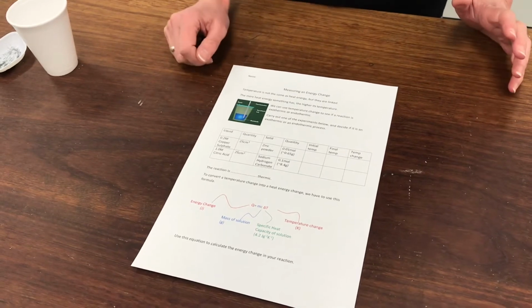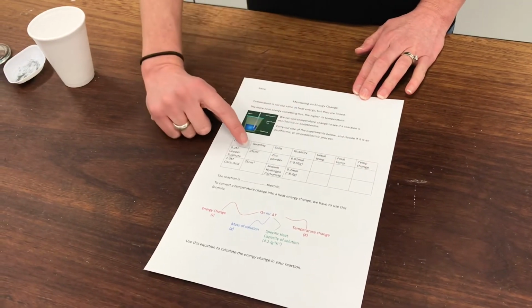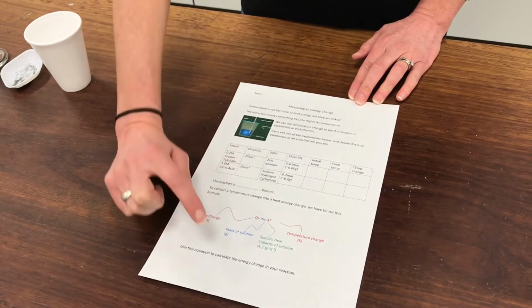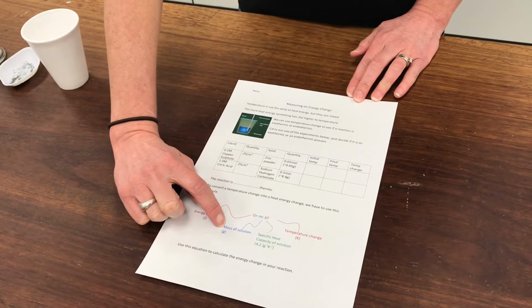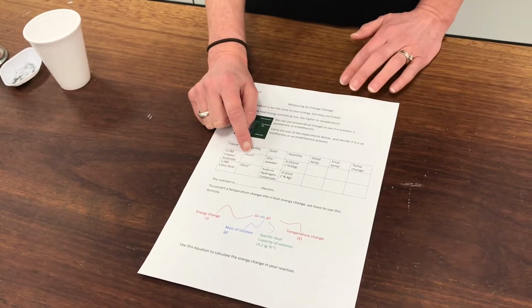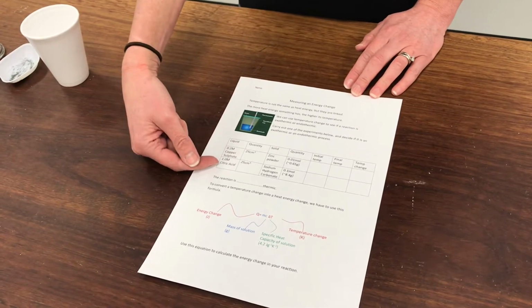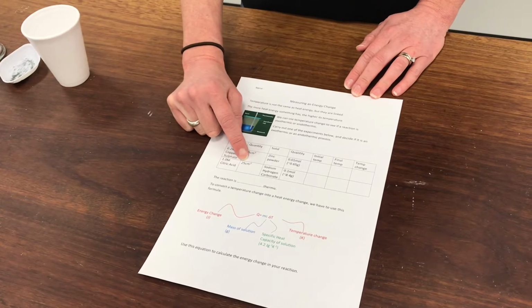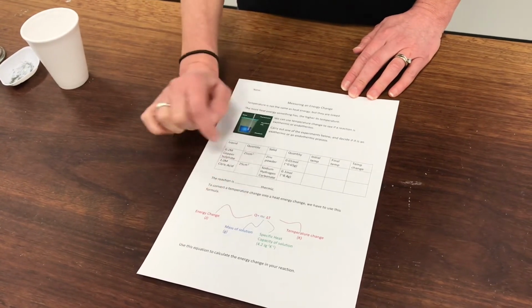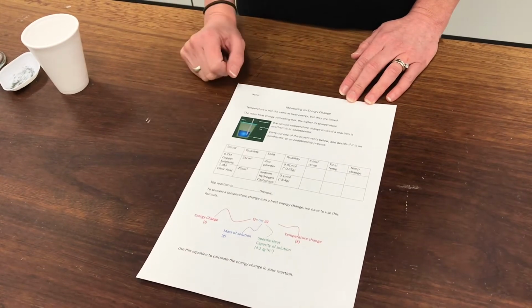So in a moment, I'm going to do this top experiment here with copper sulfate, and you can see from my table here that I'm going to be using 25 centimetres cubed of copper sulfate. So my value for M in this formula later is going to be 25. So 25 grams for the 25 centimetres cubed of liquid that I'm using. And later, when I do the citric acid experiment, you can see I'm using 25 centimetres cubed of solution again. So the formula that I use underneath to calculate the energy will have that same value, 25 for M.